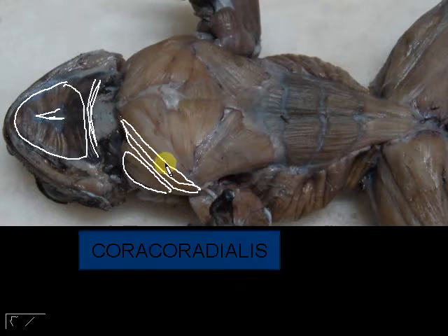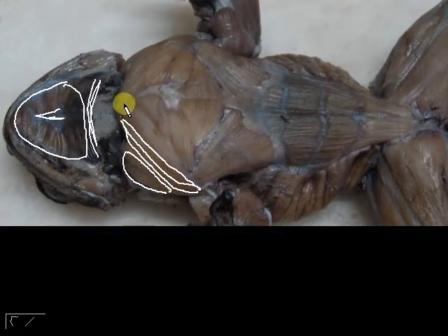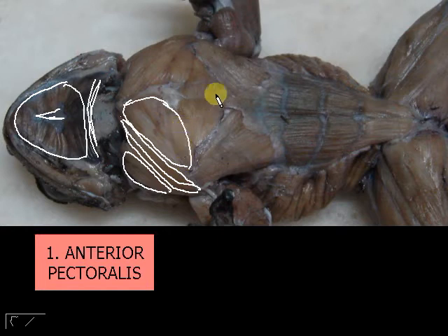That is the coracoradialis. Now next would be these muscles right here. That would be your anterior pectoralis.